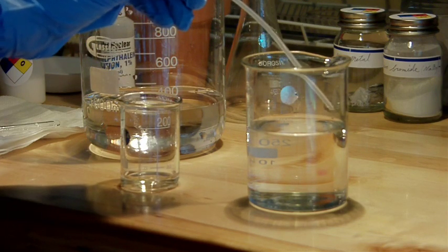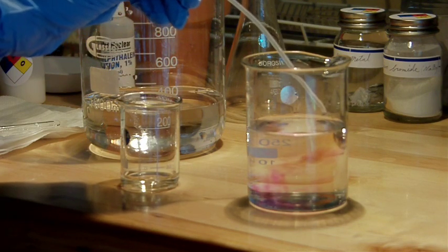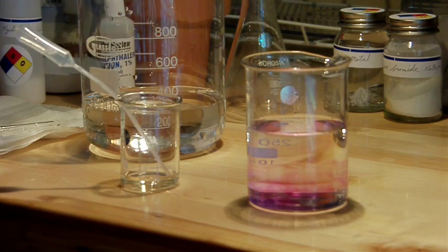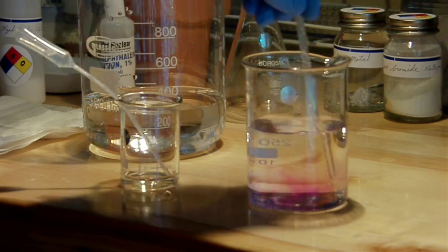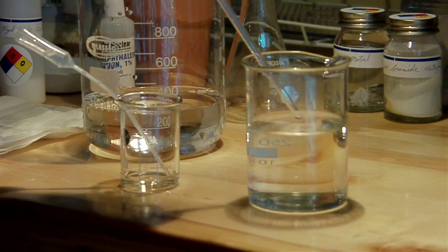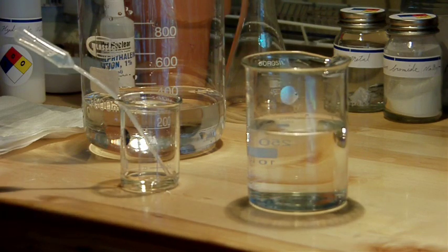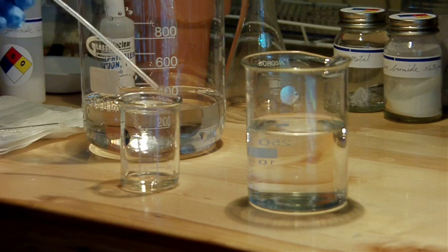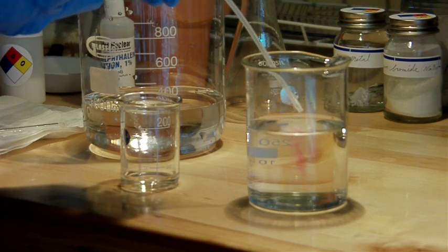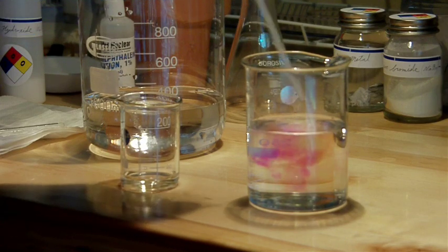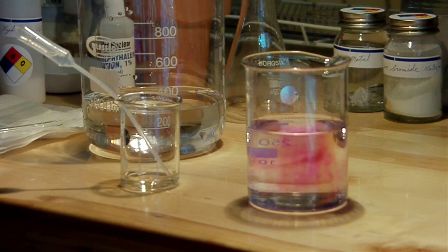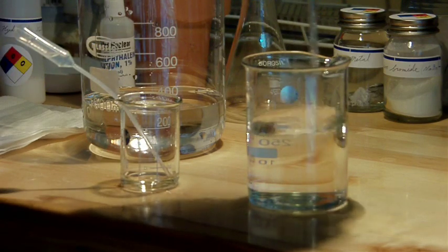By the way, I should be using a burette to do this experiment so that I can more accurately measure how much I'm actually adding, but I don't have one. So I'm just going to take whatever solution is remaining and subtract it from whatever I started out with. And I'll get a pretty decent idea of how much I expended in the reaction.